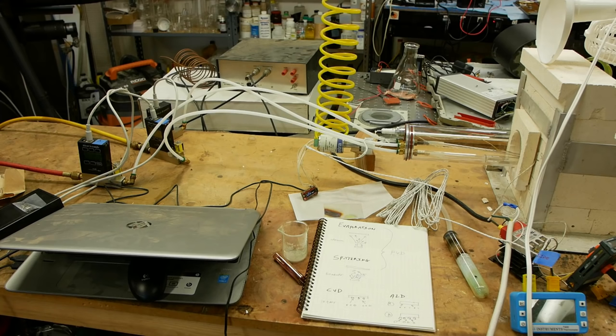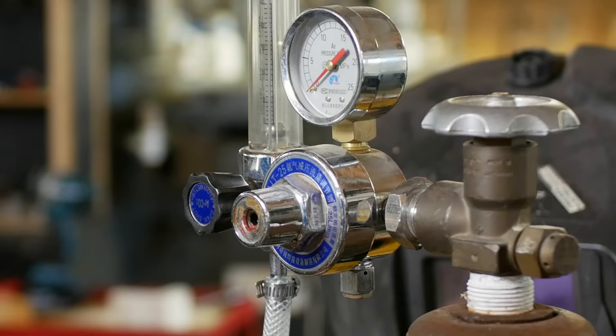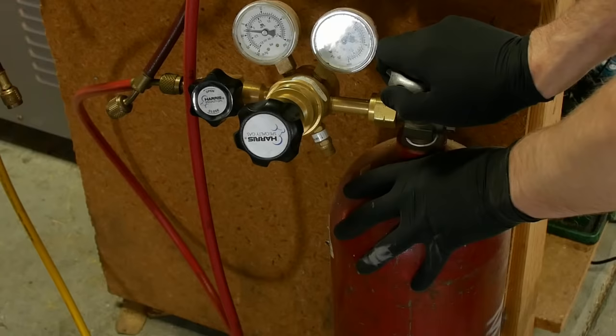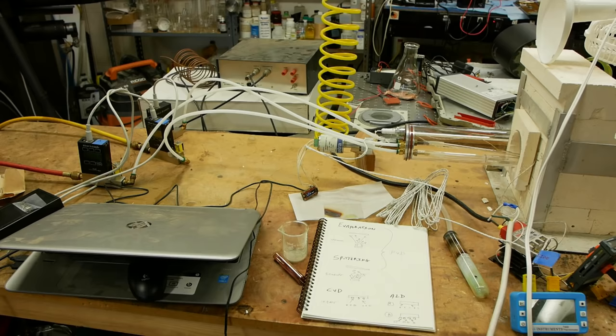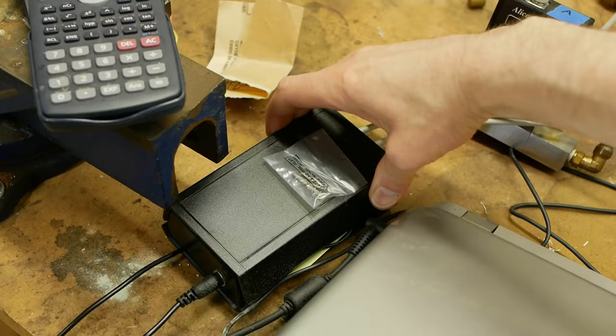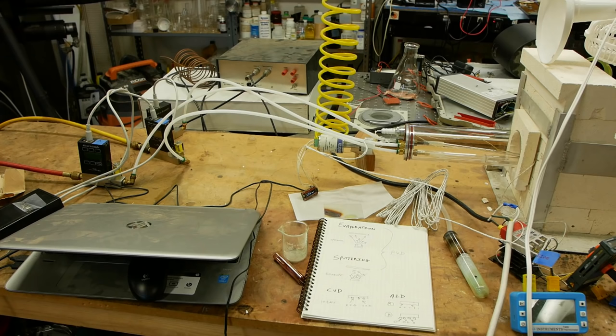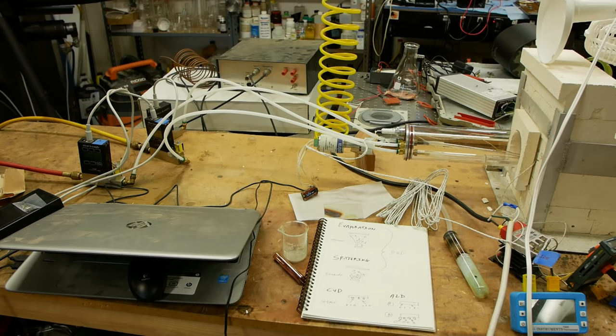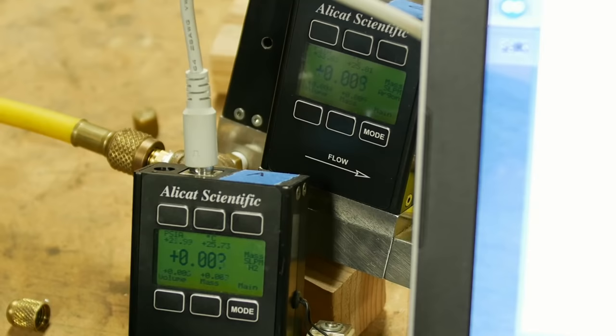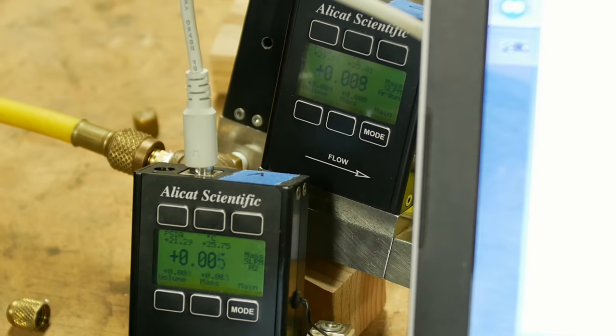So let's see what this thing looks like in real life. On the left we've got argon coming in the yellow hose and pure hydrogen coming in the red hose. And we actually have three flow controllers that the computer is controlling via a Teensy. So the Teensy sends serial commands to those flow controllers, the Alicat, and the flow controllers regulate A and B. We turn one on to get A in and then we turn B on to get the other. The reason that we have three flow controllers is because we also have to have a sweep gas that sweeps the chamber of all the A before we switch to B. We can't have A and B in there at the same time.